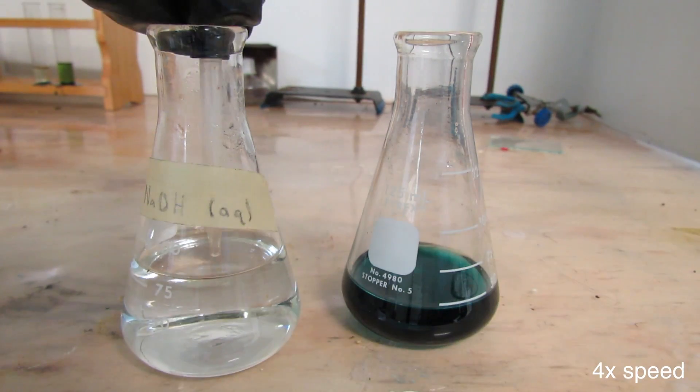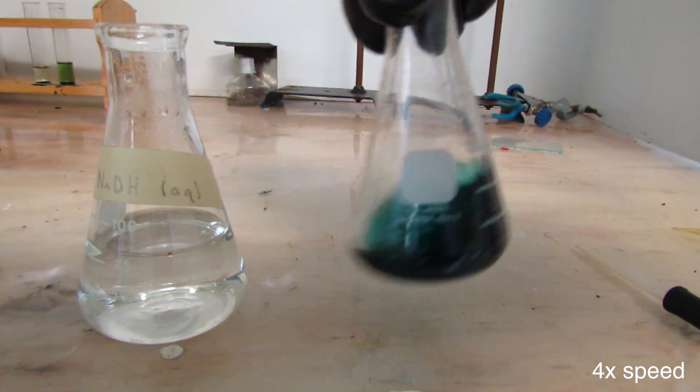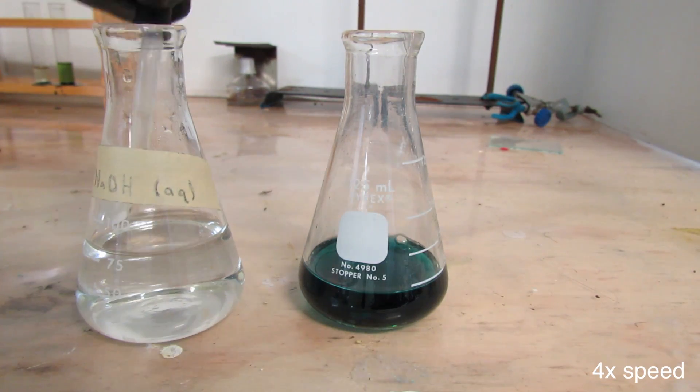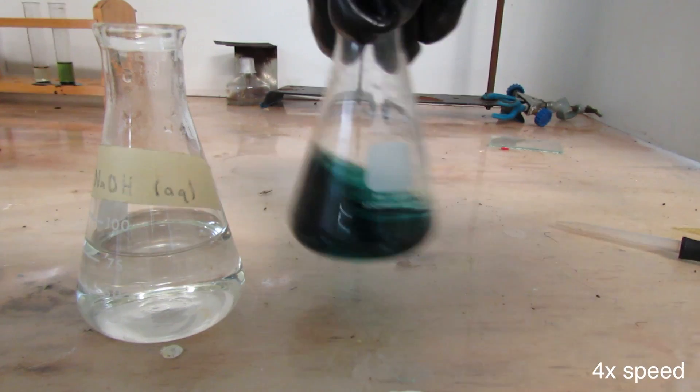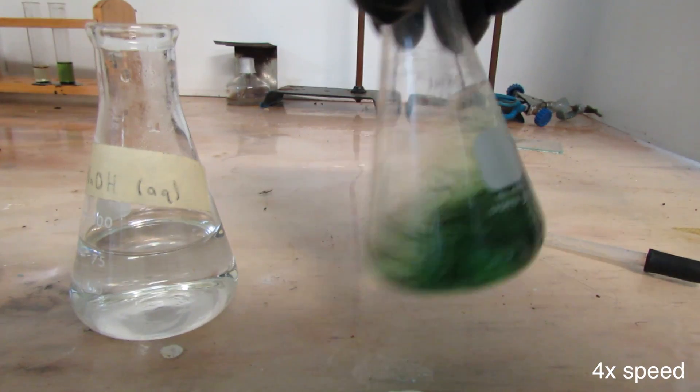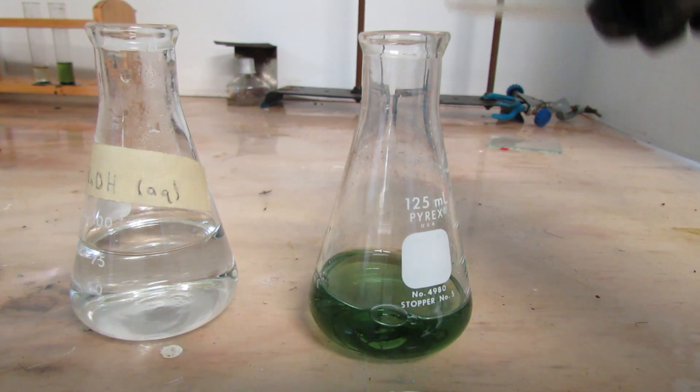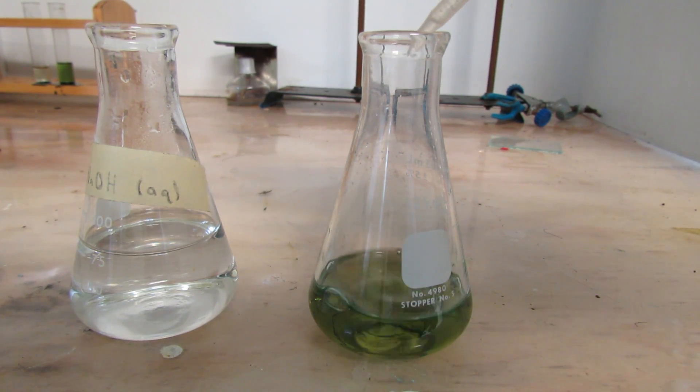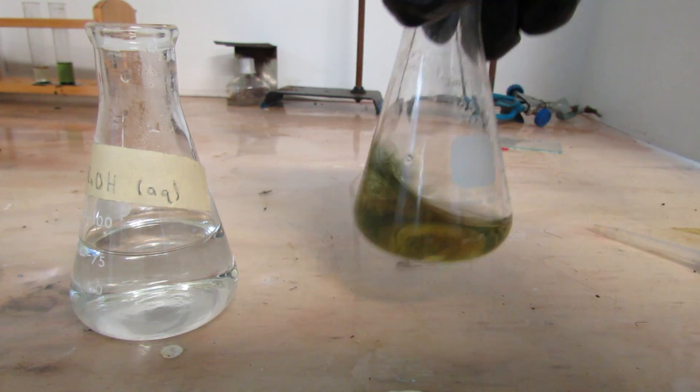I have this clip sped up a little bit and you can see that the solution is beginning to lighten in color just a little bit, very slightly, and it turns a greenish color and then all it took after that was just a couple more drops and it was back to that brownish color.